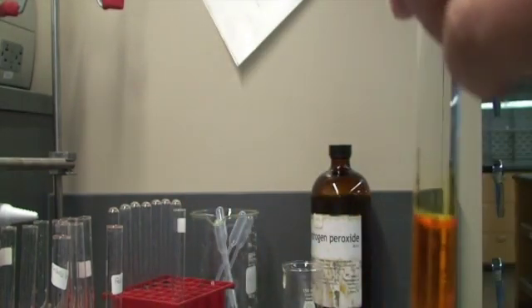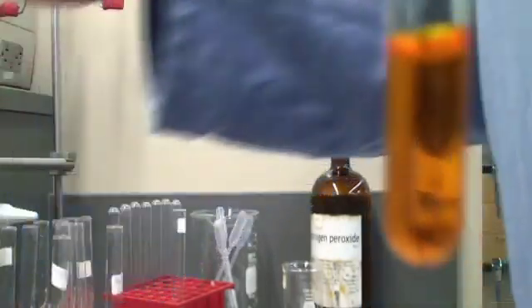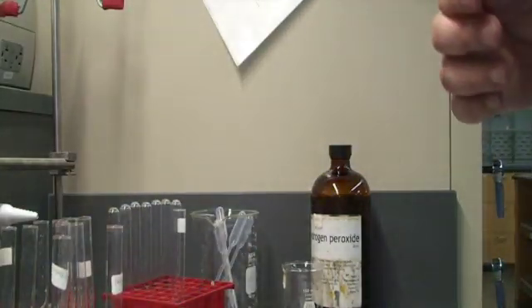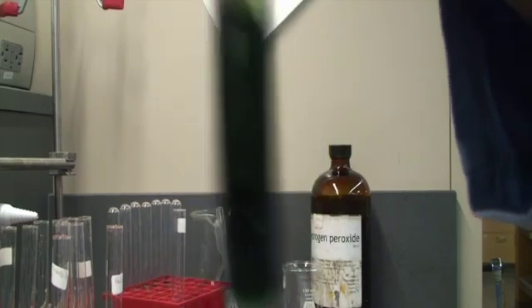We're going to add 2 milliliters of iron(II) sulfate. Here's our first milliliter — oh, look at that, it changed right away! It went from being a really nice orange to a very deep green — in honor of St. Patrick's Day today.